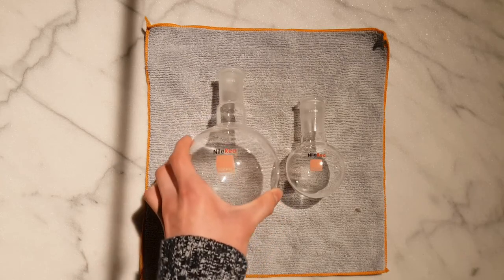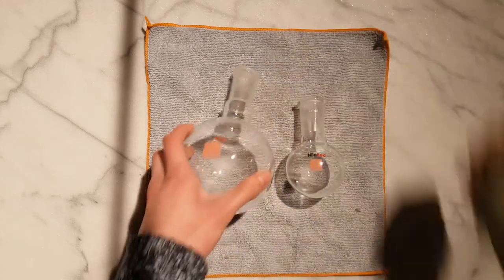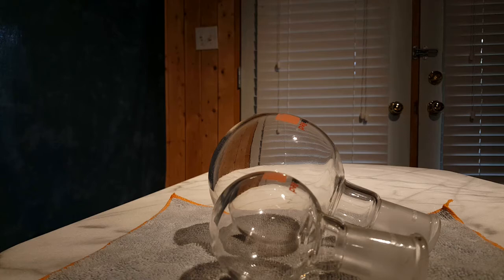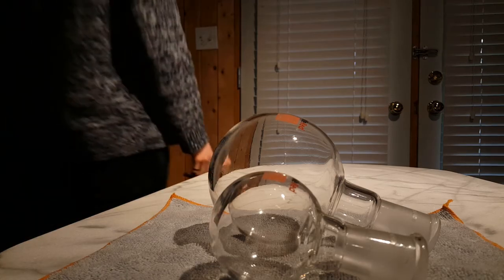Having finally completed this experiment, I rinsed out the flasks, and I'm going to blow some air in there every day with my bulb pump, just to flush out any smell that might have remained. Overall, it feels pretty good to bring this project to a close after three years of ignoring it on my desk, and now I'm ready for a whole lot more new experiments in the future. Thank you.